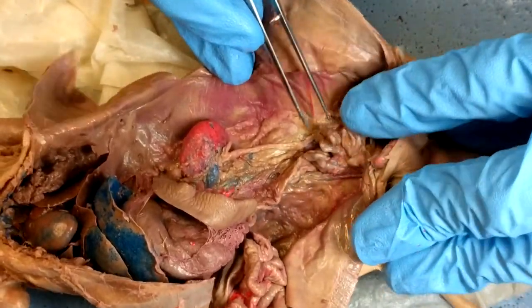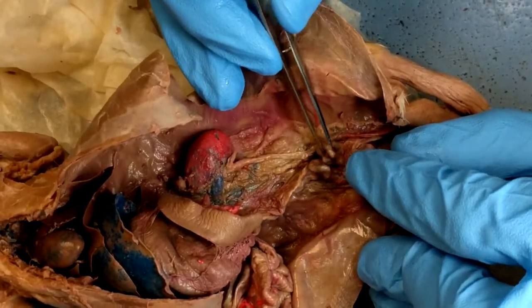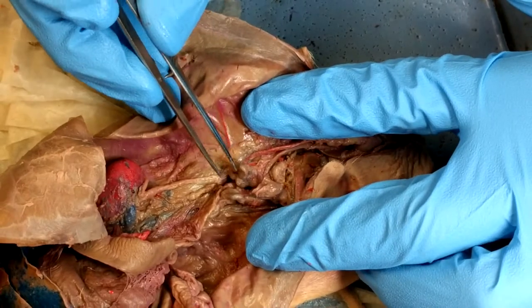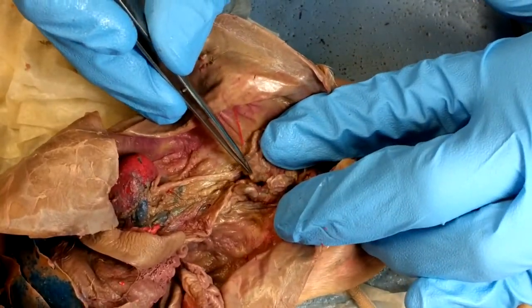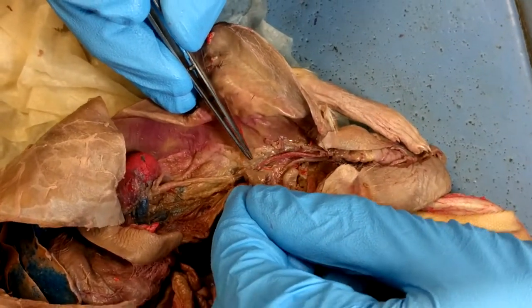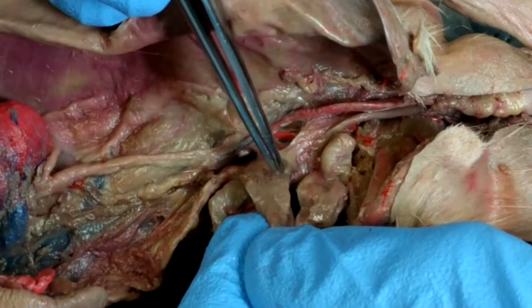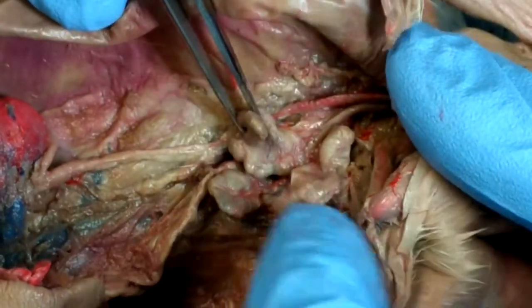The urinary bladder was this structure here. Right above it is where you find the vesicular and coagulating glands — those two are attached to one another. The vesicular part is the top, larger, more crinkled surface. The coagulating gland is usually the smaller, smoother area. So there are two of those.